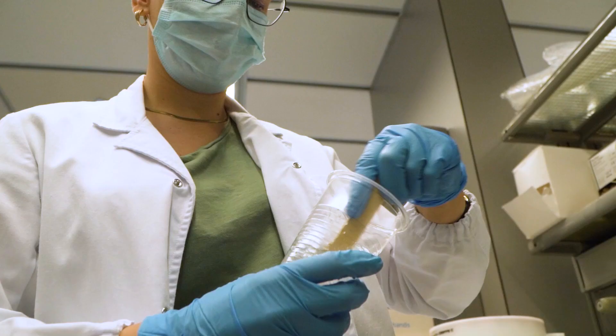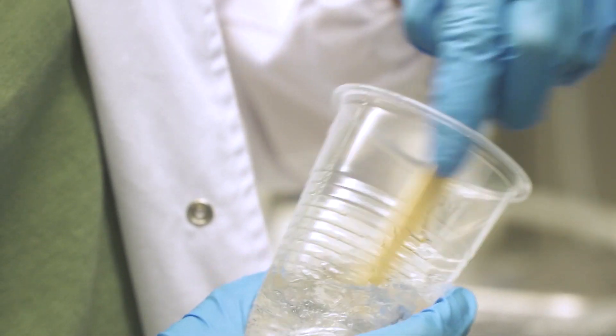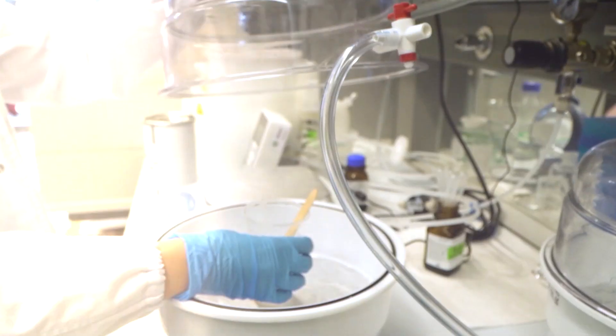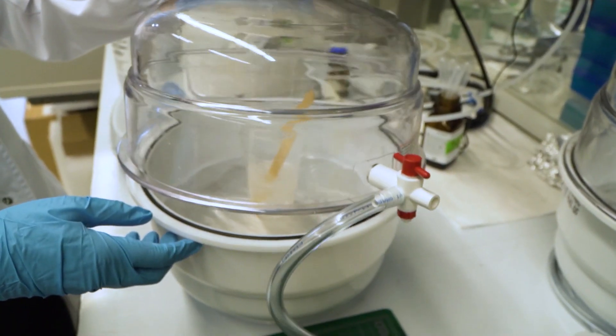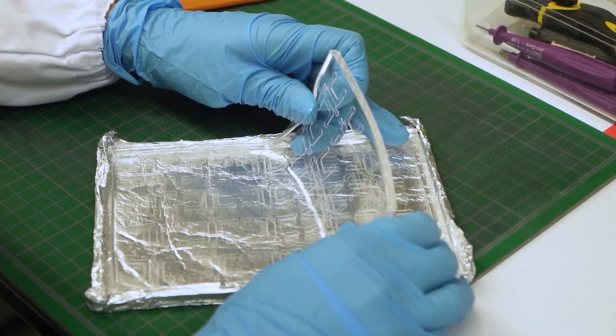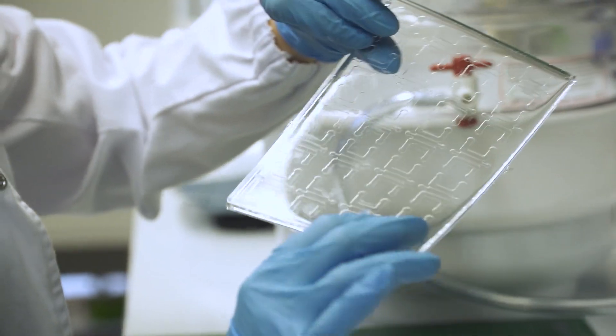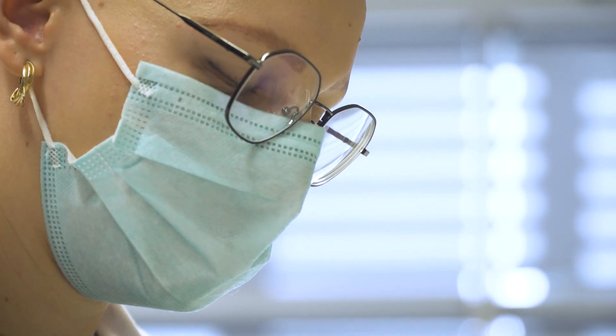PDMS is a transparent and biocompatible polymer that is poured as a liquid into a prefabricated master negative mold. Then we let the PDMS cure overnight and when it solidifies we cut and punch each device.